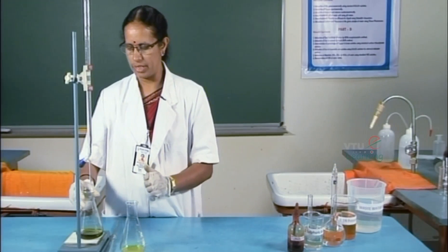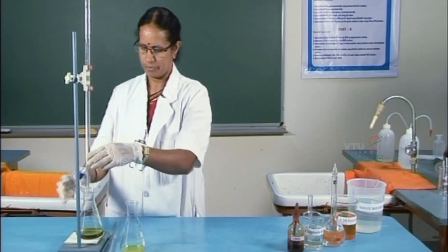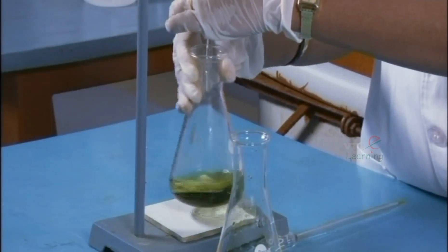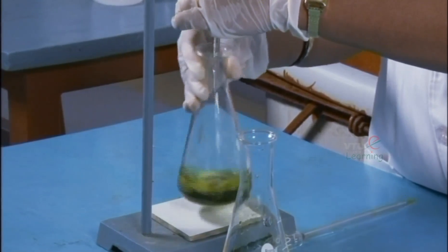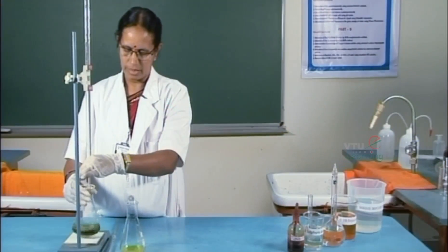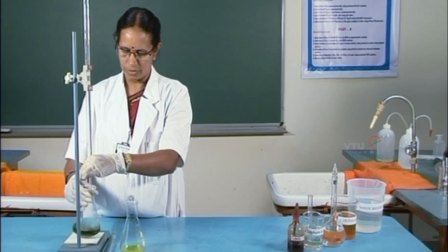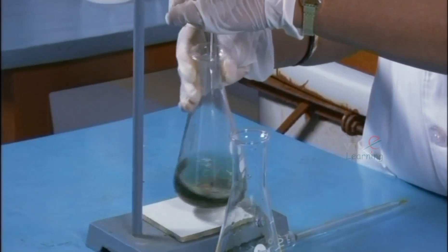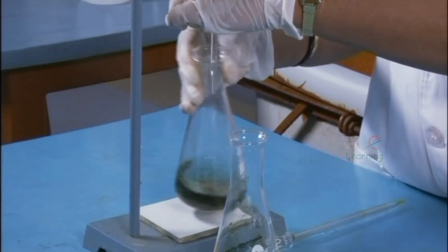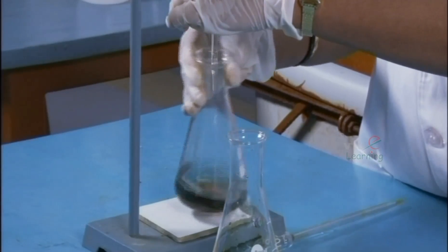It is titrated against standard FAS solution. This titration is the back titration, which gives the estimation of unreacted potassium dichromate. Near the end point, the solution turns from green to reddish brown. This is because the oxidation state of the iron in the indicator changes.